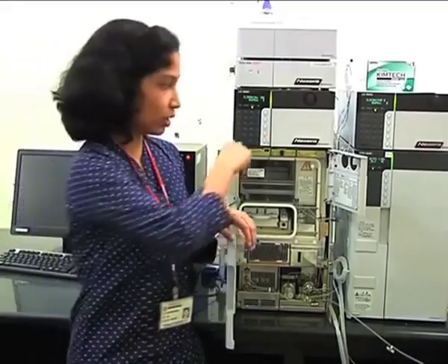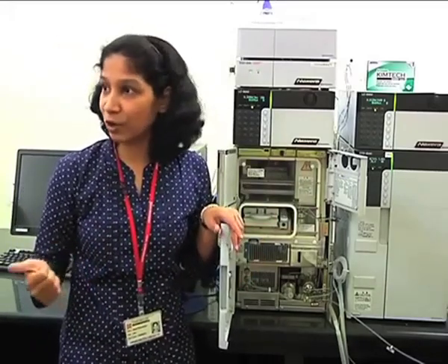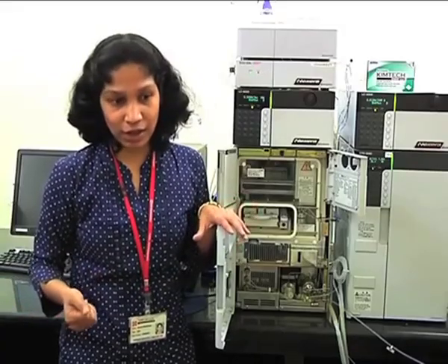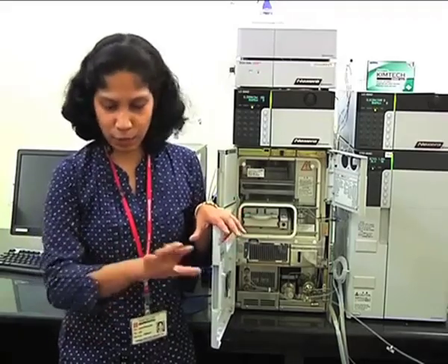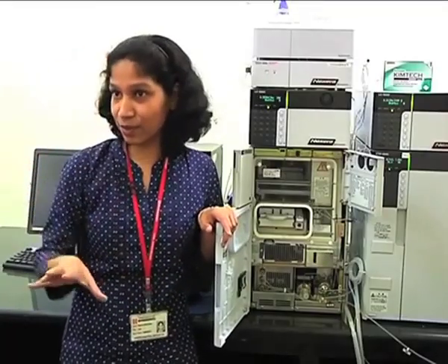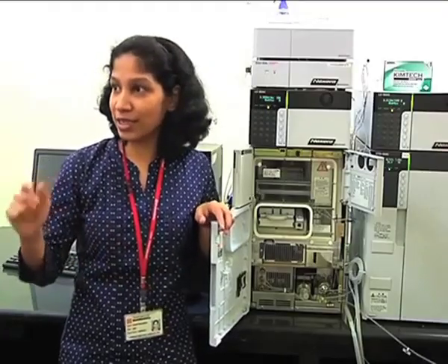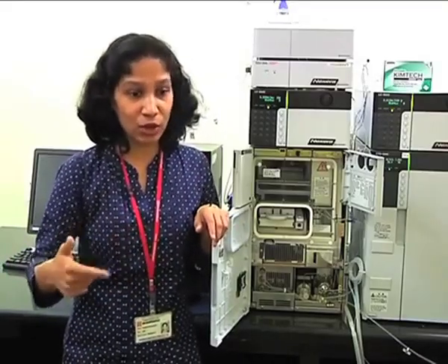Right? Also, this is a fast autosampler. It takes only 10 seconds to inject 10 microliters of sample. So this function is very important when you perform fast HPLC kind of analysis. Suppose this is generally for a small molecule assay, where you want to quantify only one particular compound in your sample, and your runtime is as short as 1 or 2 minutes, and if your autosampler takes 45 seconds to inject one sample, you are definitely losing on throughput.